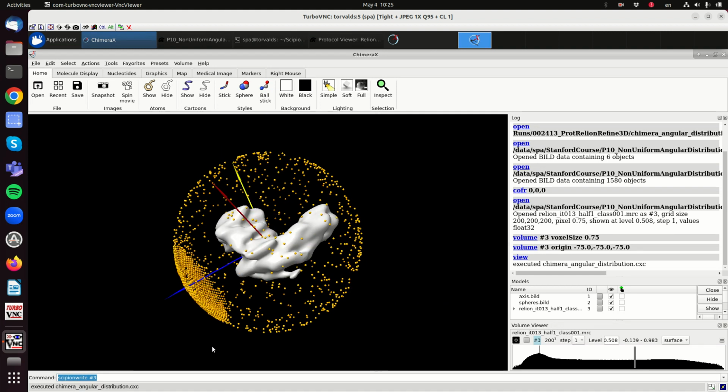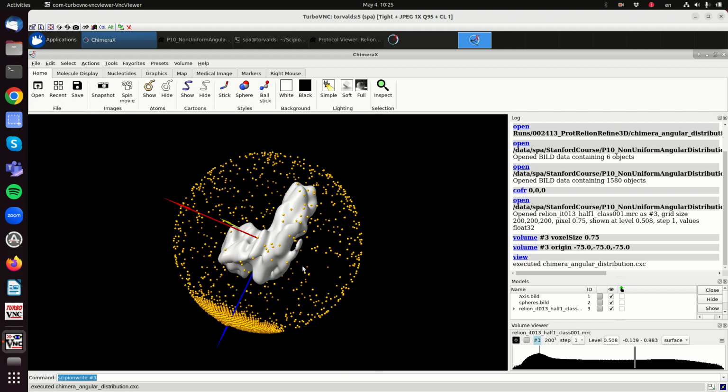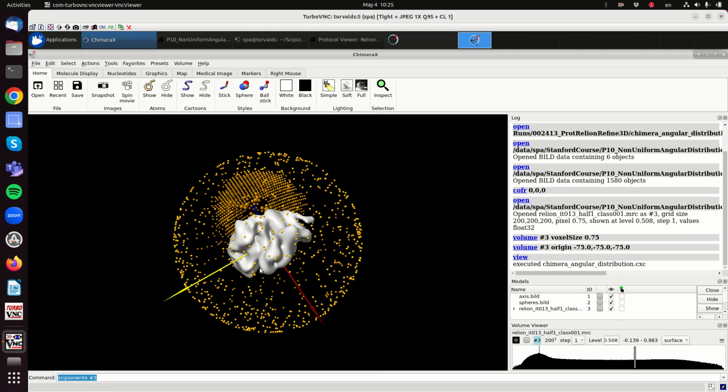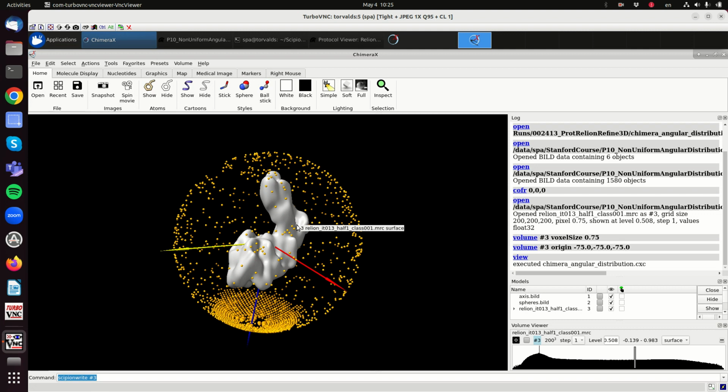Okay, so this is a problem of signal to noise ratio, overloaded directions, and having to estimate the angles. By itself, having an overloaded direction shouldn't cause any problem, and reconstruction algorithms can handle the different densities of points. But when you have to estimate the angles and you have low signal to noise ratio, you are more prone to make mistakes along the overloaded direction, because it is gaining signal to noise ratio and then it is attracting more particles around.